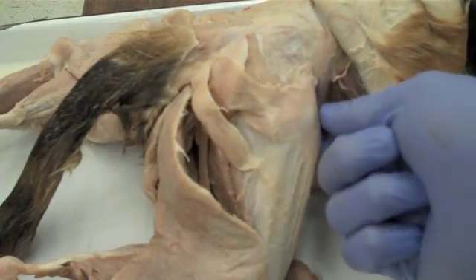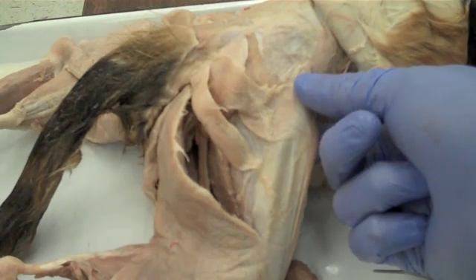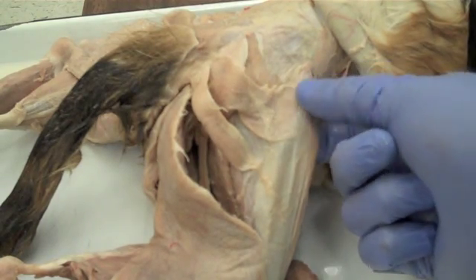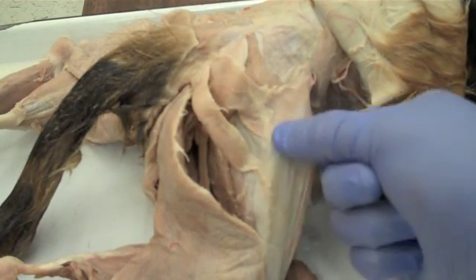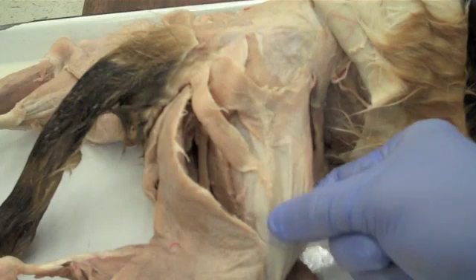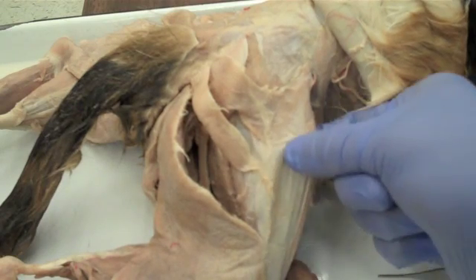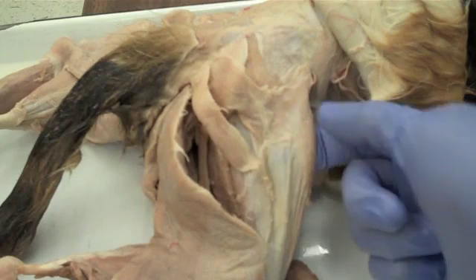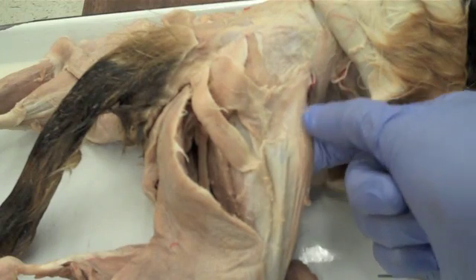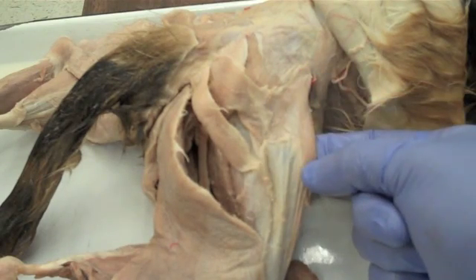If I lift it up, you can see what the tensor fasciae latae and the gluteus maximus insert into, which is this white sheet here called the IT band, or the iliotibial tract — or more simply just the fascia latae, named after the tensor of the fascia latae.